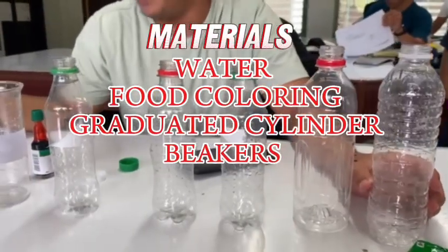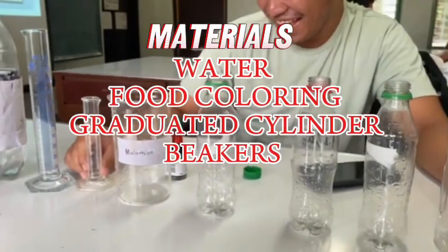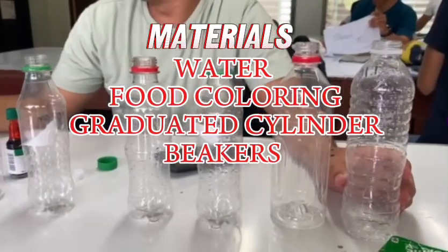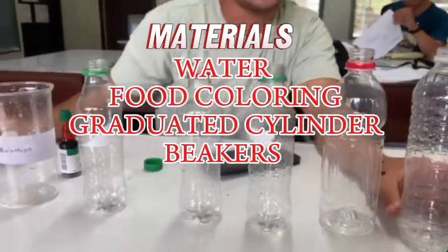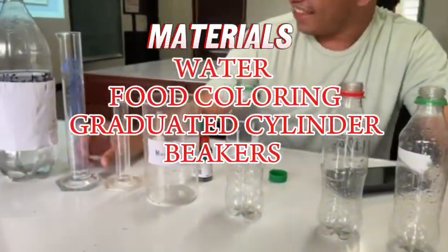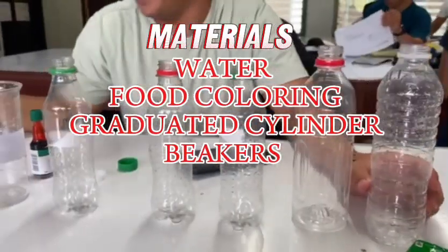The materials are water and food coloring as a substitute for insecticides, a graduated cylinder, a beaker, absorbent paper, and water bottles.